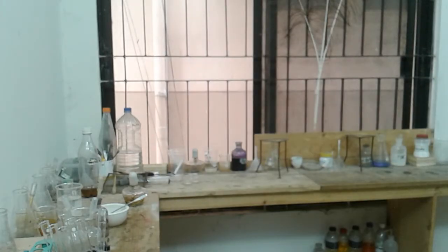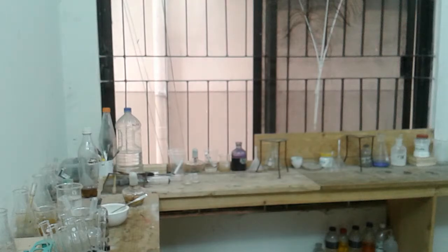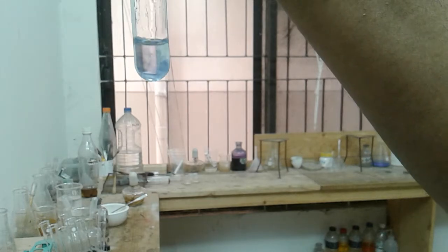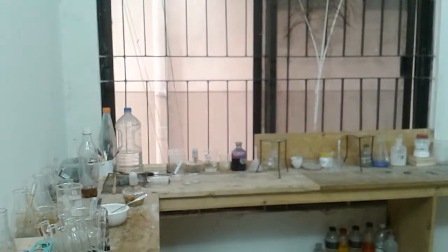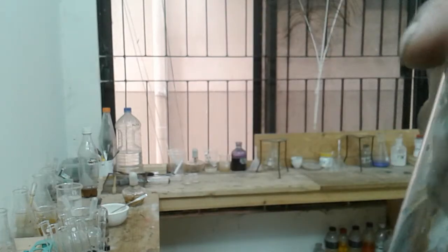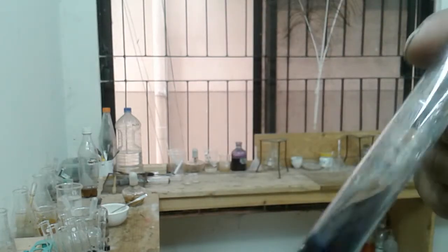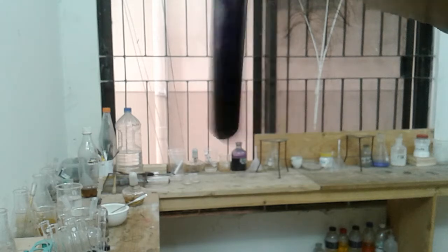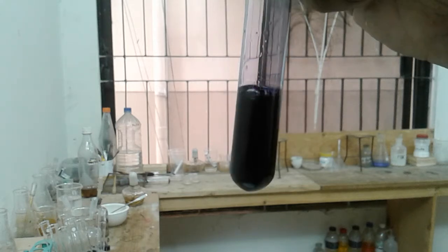Now we are adding the equal volume of hydrogen peroxide here. So this was the volume that we have got. Oh, it's turning blue black. So starch is present and it turns blue black, so it must be iodine, isn't it? Because in the last test we have added starch in iodine, we have got blue black. So we have again got a color blue black, so must be iodine is present here.